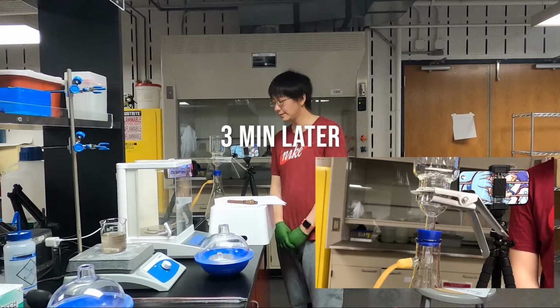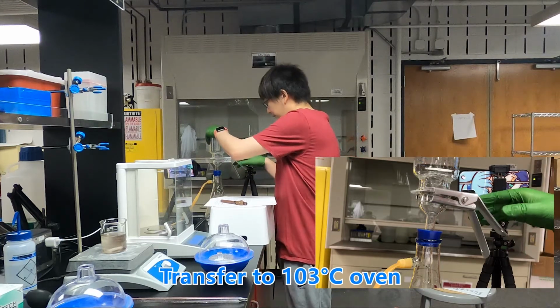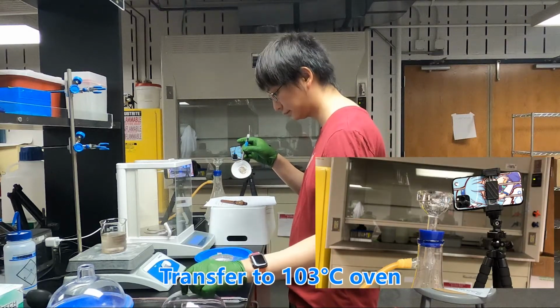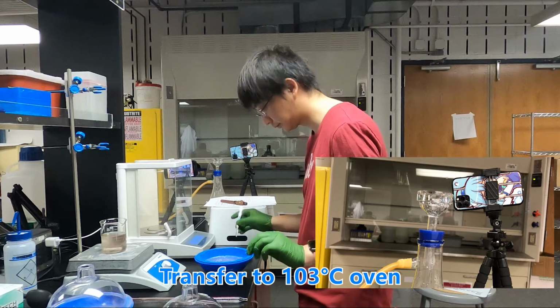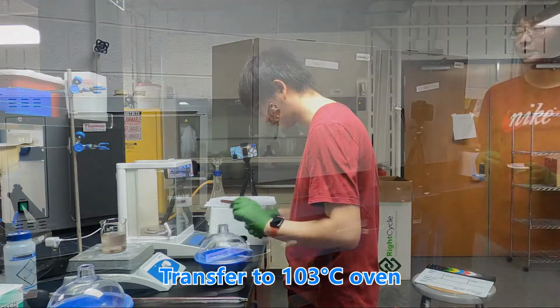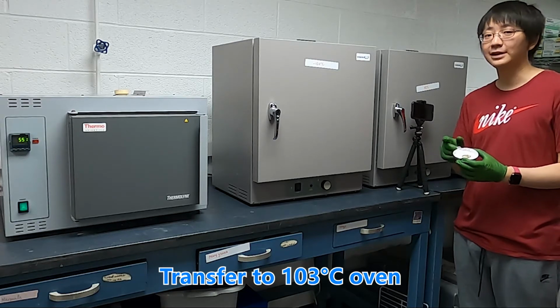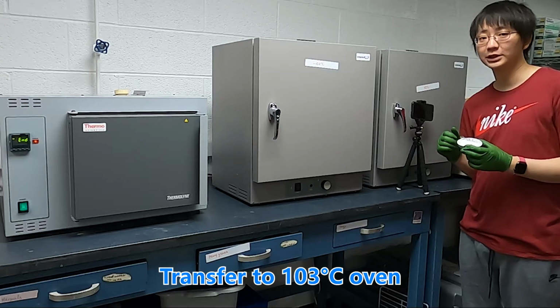And then after 3 minutes, we are going to take the filter. And now we are going to put the filter with the aluminum plate into a 103 Celsius degree oven to remove the water.